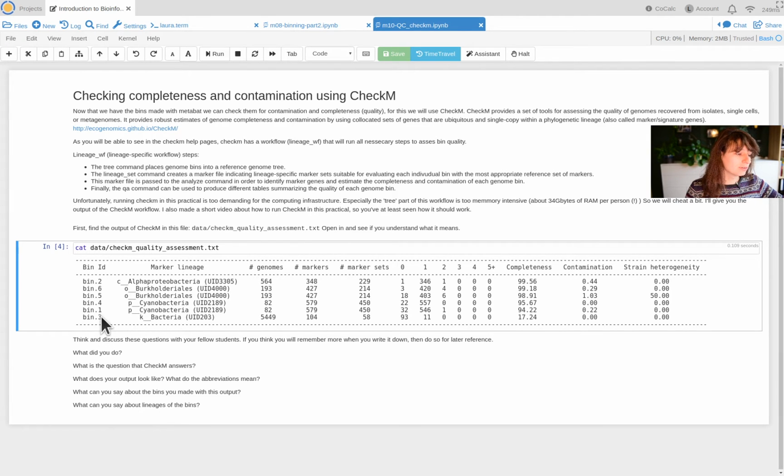So you see these different bins. They were assigned a lineage, but not all at the same level. So kingdom is very unspecific. Basically, it tells you no idea what this is. And for alpha proteobacteria and for Burkholderiales, that's actually quite specific, so that's well done.